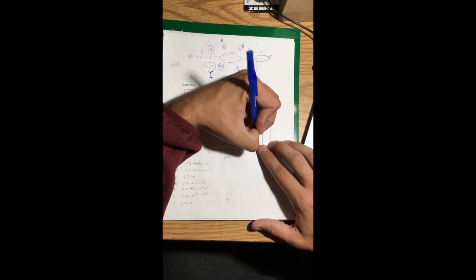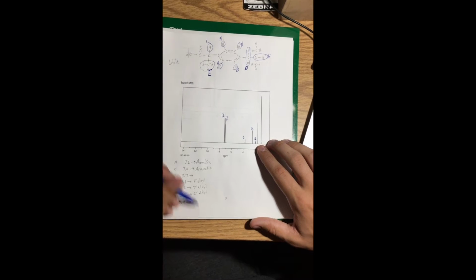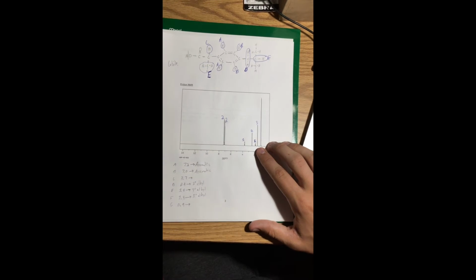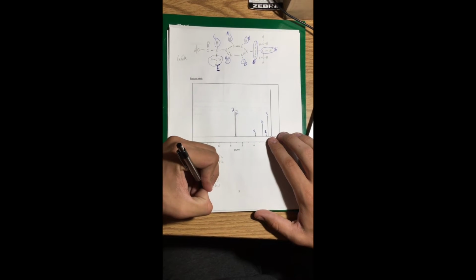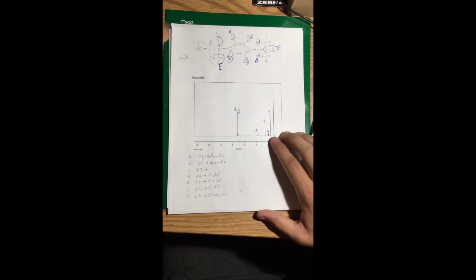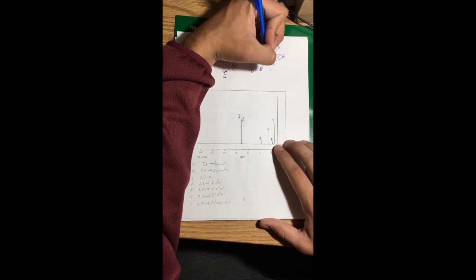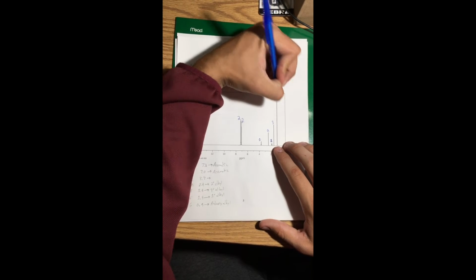It'll be 1 actually. And then we move over to the 1.4, which is a primary alkyl. It's only attached to 1 carbon, 3 hydrogens. I'll write down 3 for that. Then the last one applies for a primary alkyl as well, so I'll write that down. As you can see, you have 2 left here, so I'll circle both of them, label it G. And you can count up the total hydrogens, it comes up to 6.